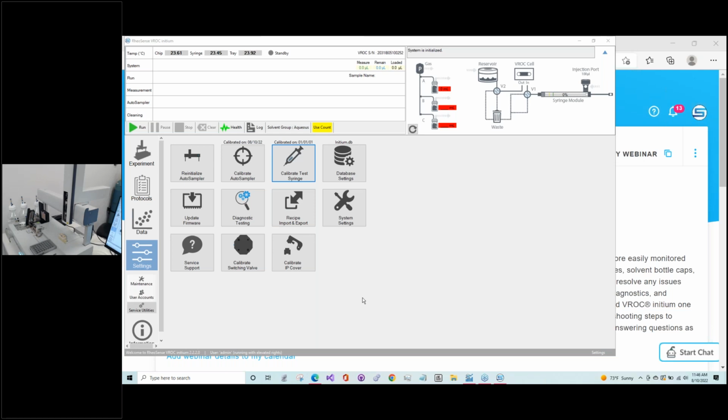going back to our software, I just want to point out a couple things. Since we're at this settings service utilities portion of the software, we've just now shown you things that you would do on your own independently without any need for having a field service engineer present. That would be the syringe piston, both on the autosampler and the test. This would be the O-rings that you can change easily. And obviously you can change out caps on solvent bottles. So those you can all do on your own.